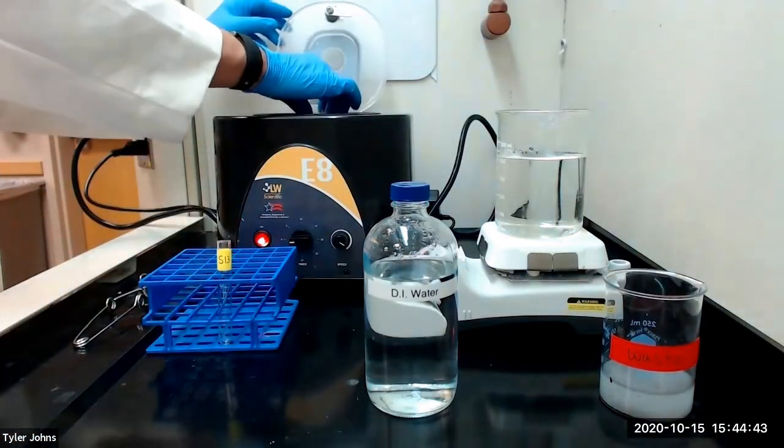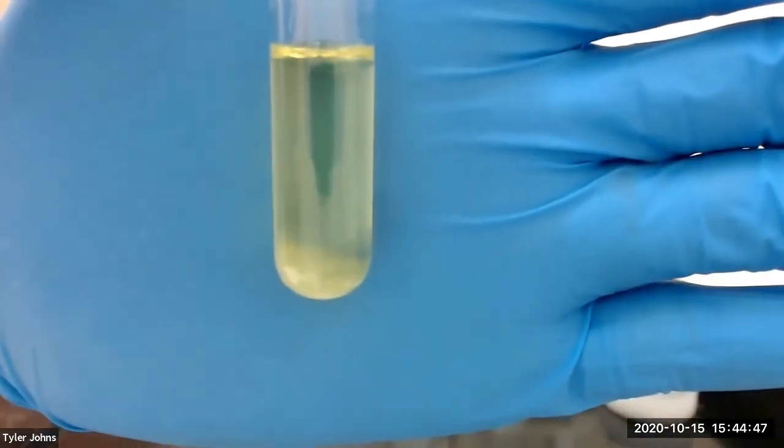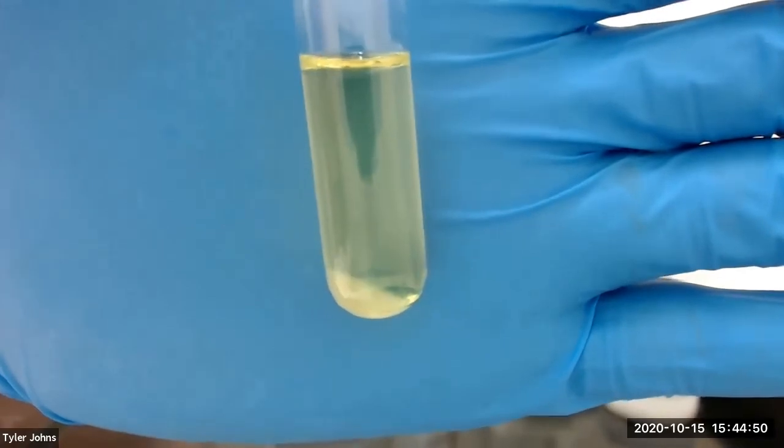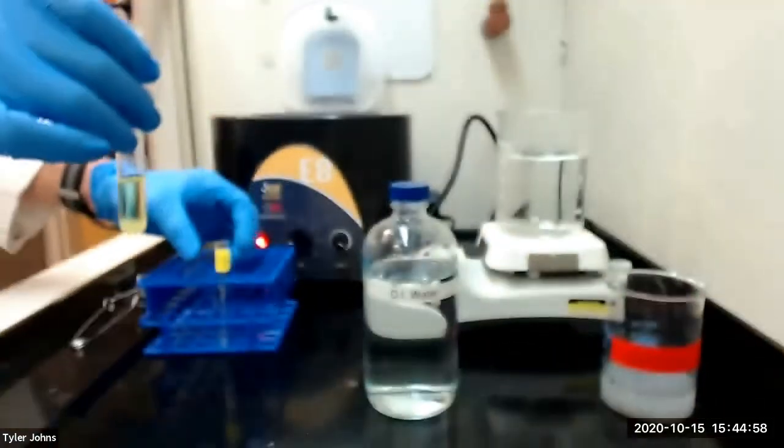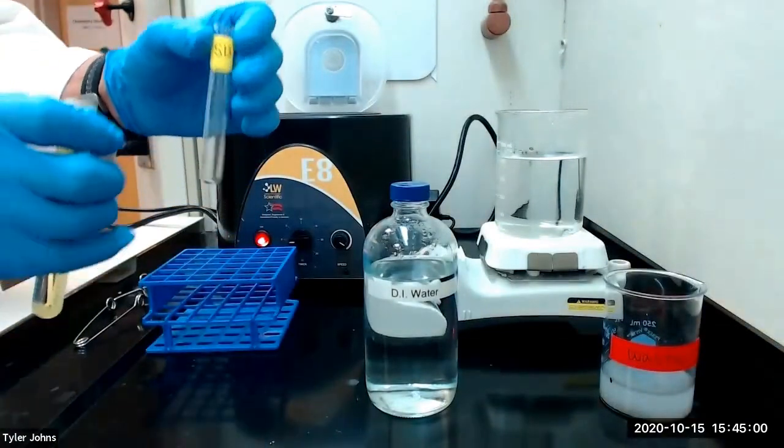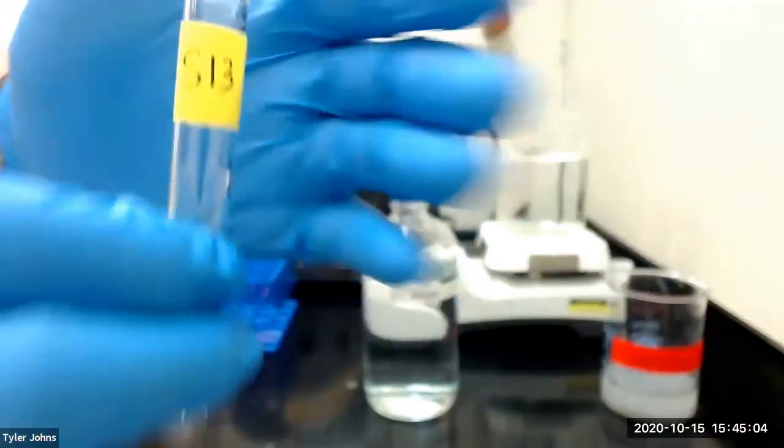This is what our mixture looks like after centrifugation. We will then decant our solution into a new test tube labeled S13 for solution 13.